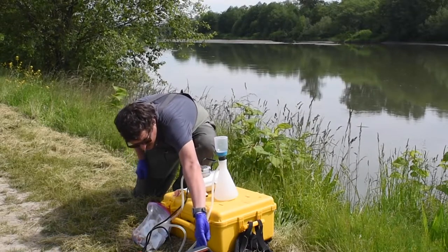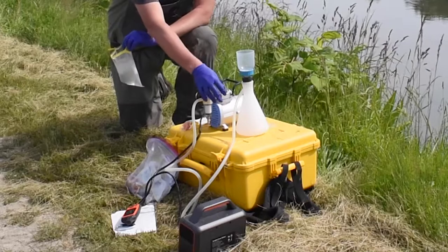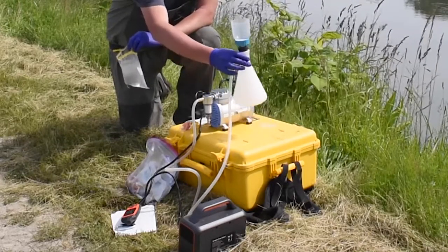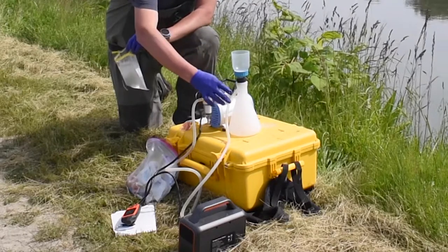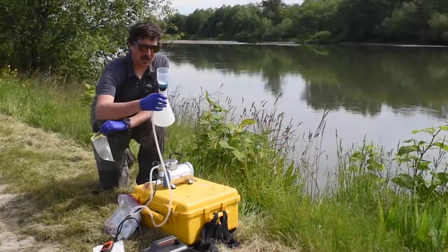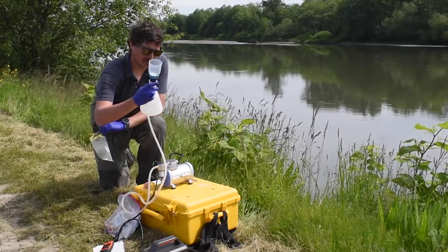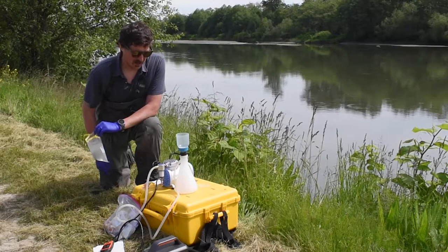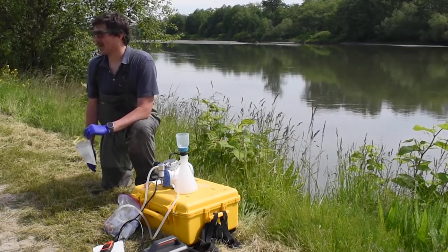I'm going to turn this on — it runs on an external battery source. This is a simple vacuum pump connected to some Masterflex tubing. We have our cylinder here, and a lot of this stuff is retrofitted in my little shop at home. You buy a lot of weird stuff on the internet and retrofit it — I'm sure a lot of you have done a little bit of that in your careers.